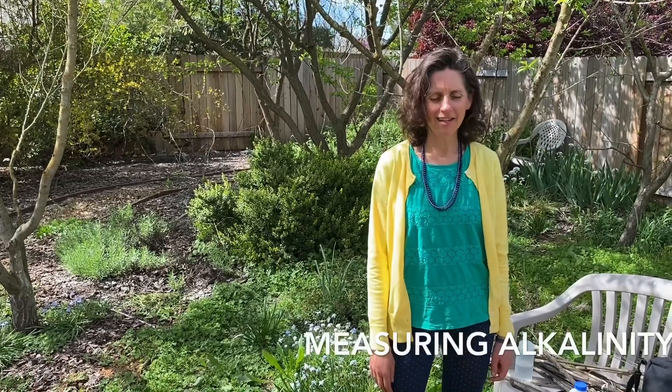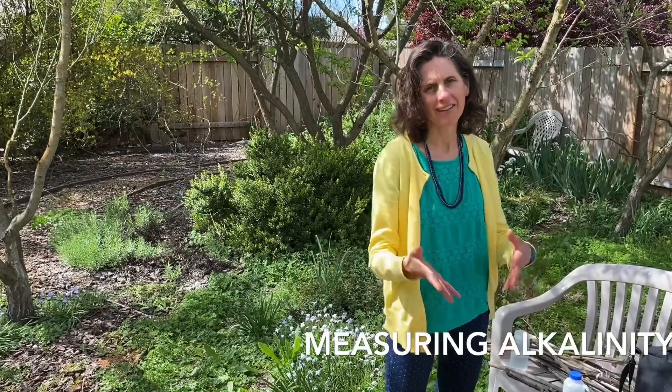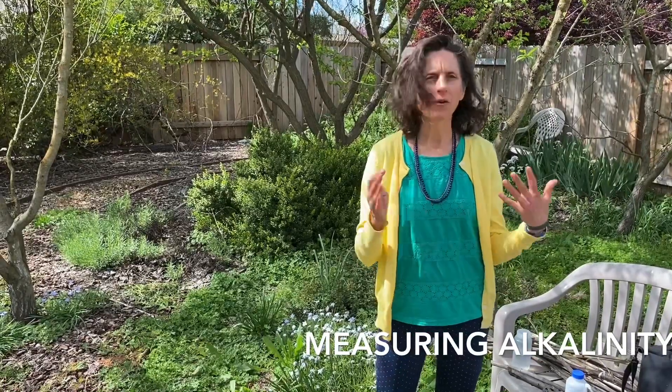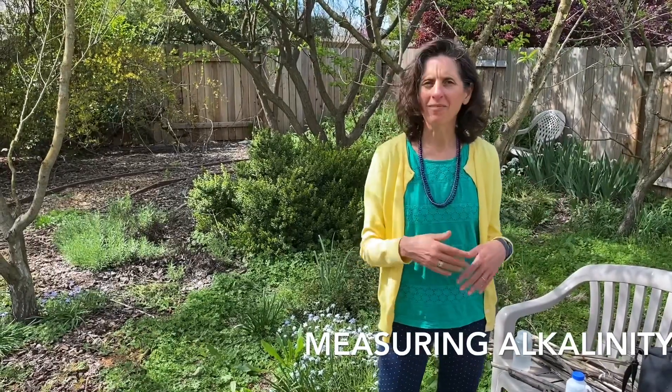Hello, it's Dr. Ai here again, and today we're going to look at how to measure alkalinity of a water sample from a creek, from tap water, or anywhere.